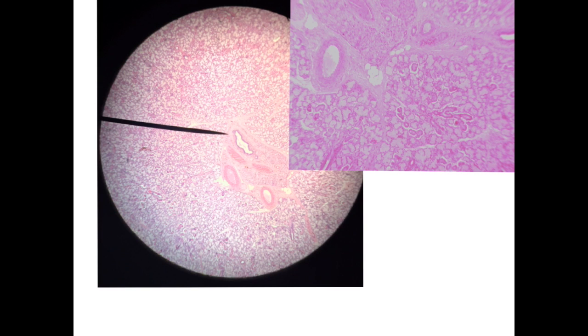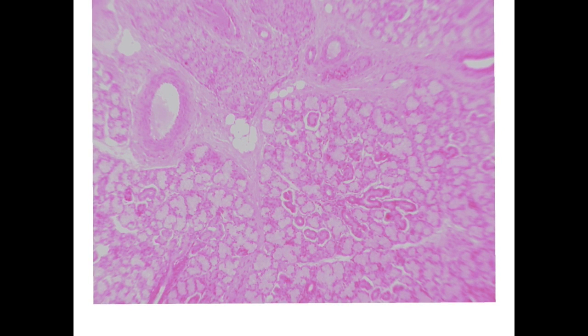Here the submandibular gland is different. Here you can see that we have these acini, but these acini are pale blue. They are not empty inside, not white inside like the alveoli. Also, you cannot see bronchioles. You can see only these ducts with no folding of the lumen, and these are blood vessels in between the lobules.